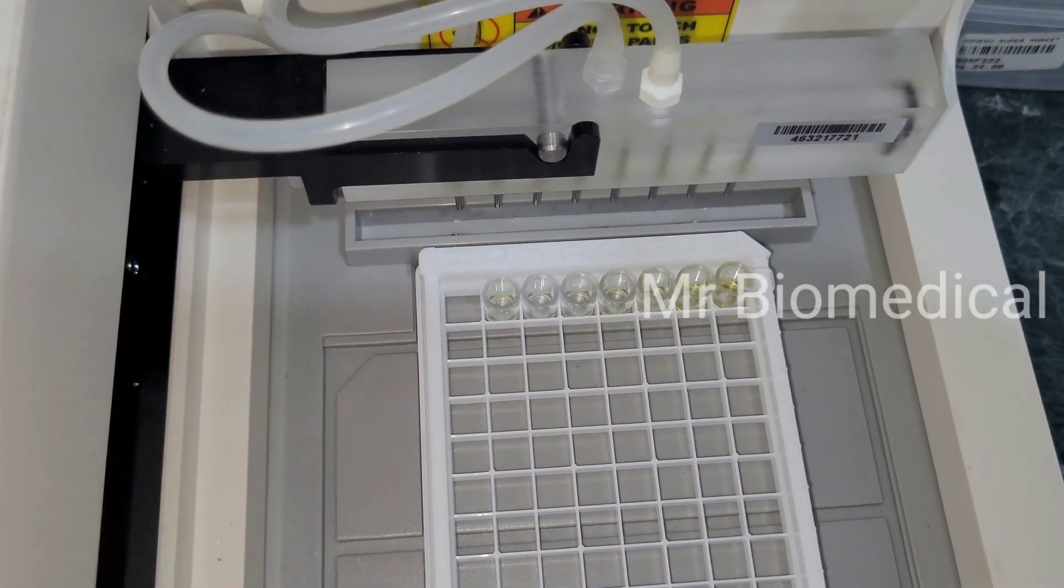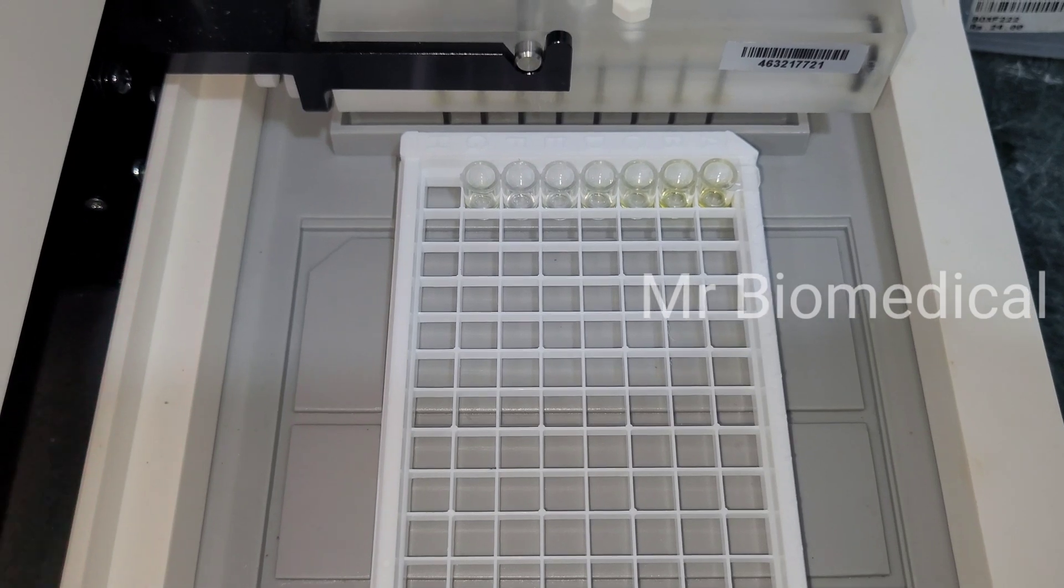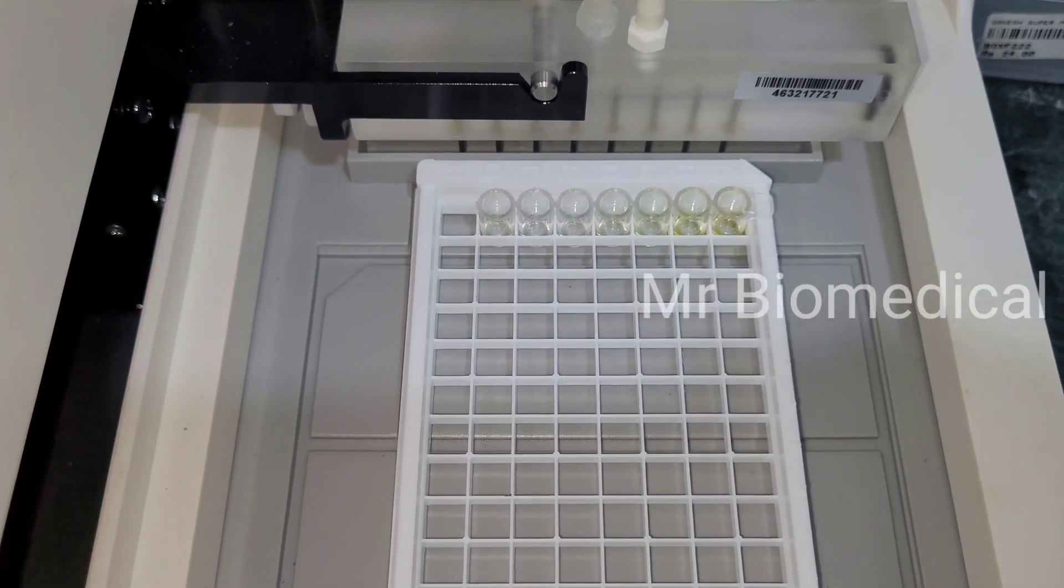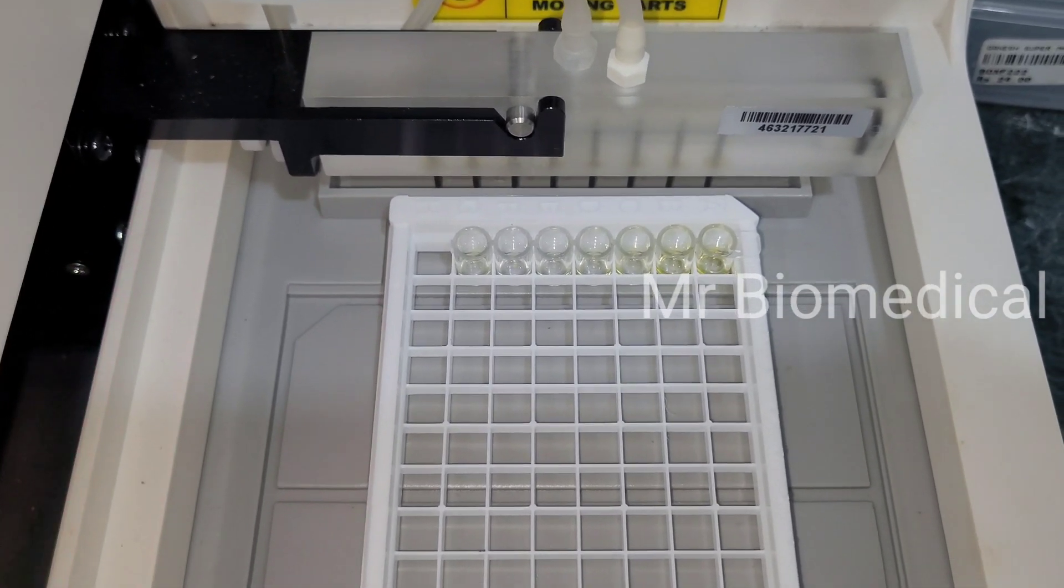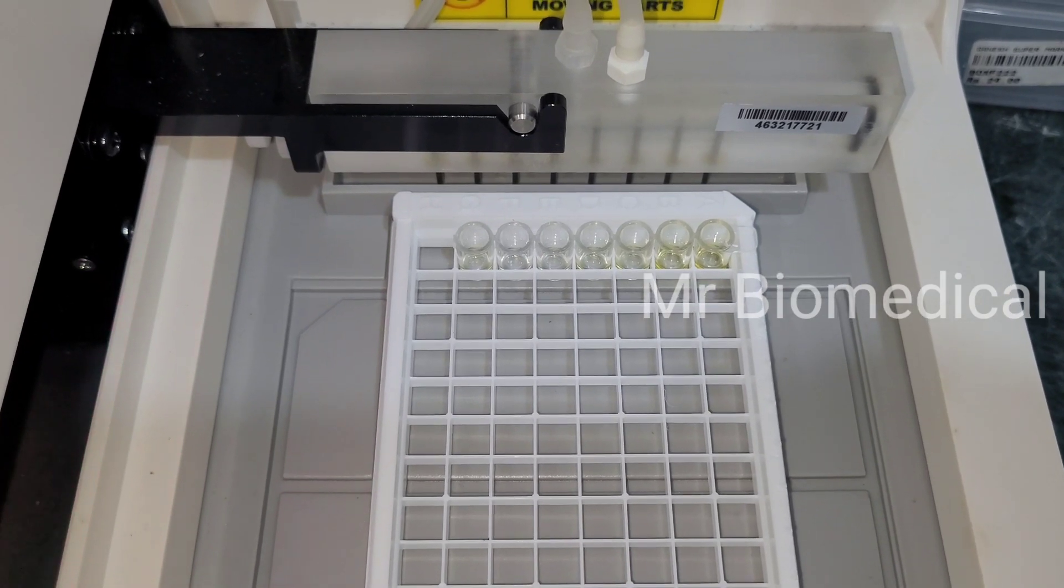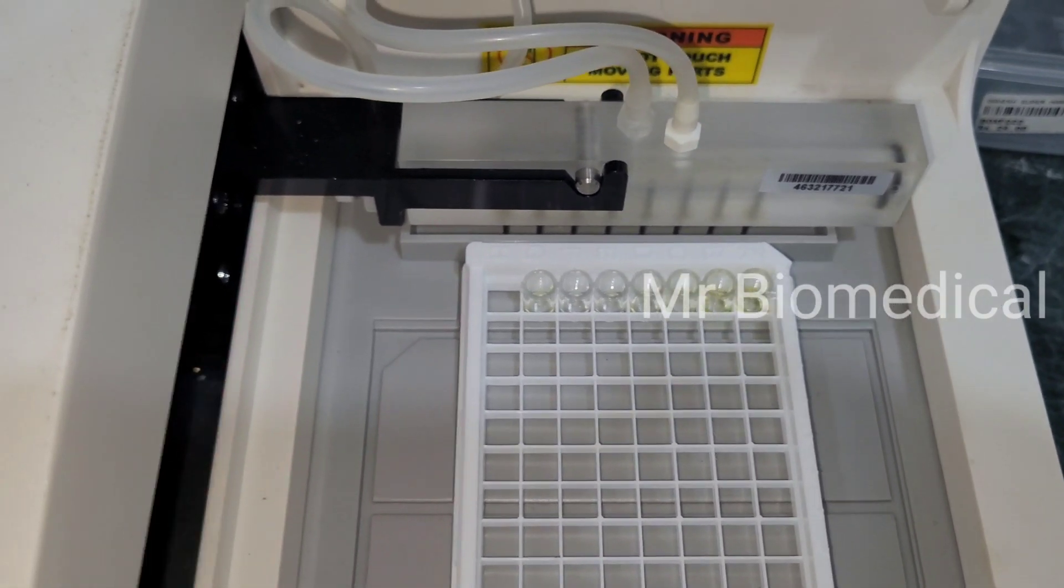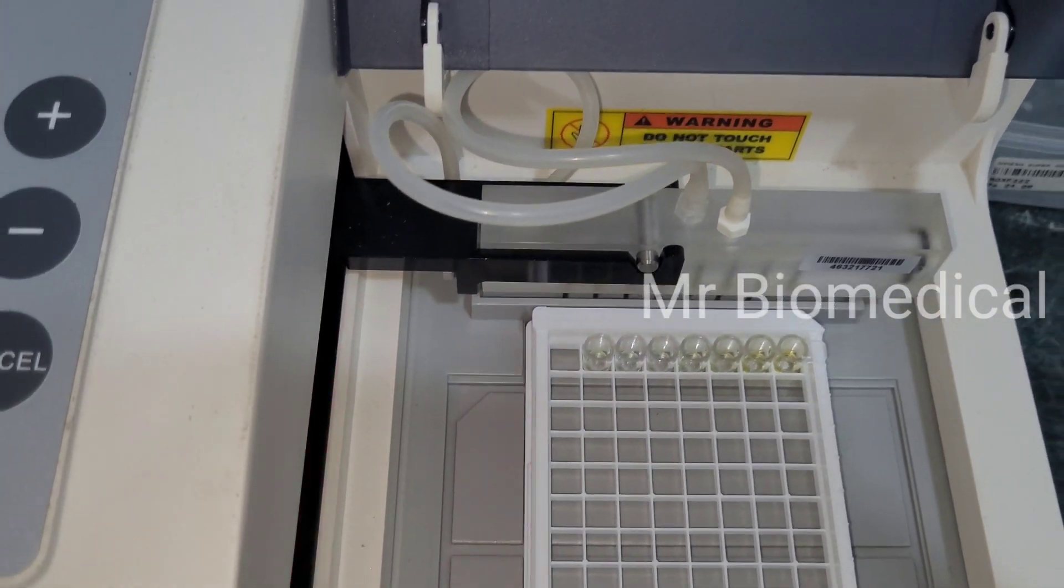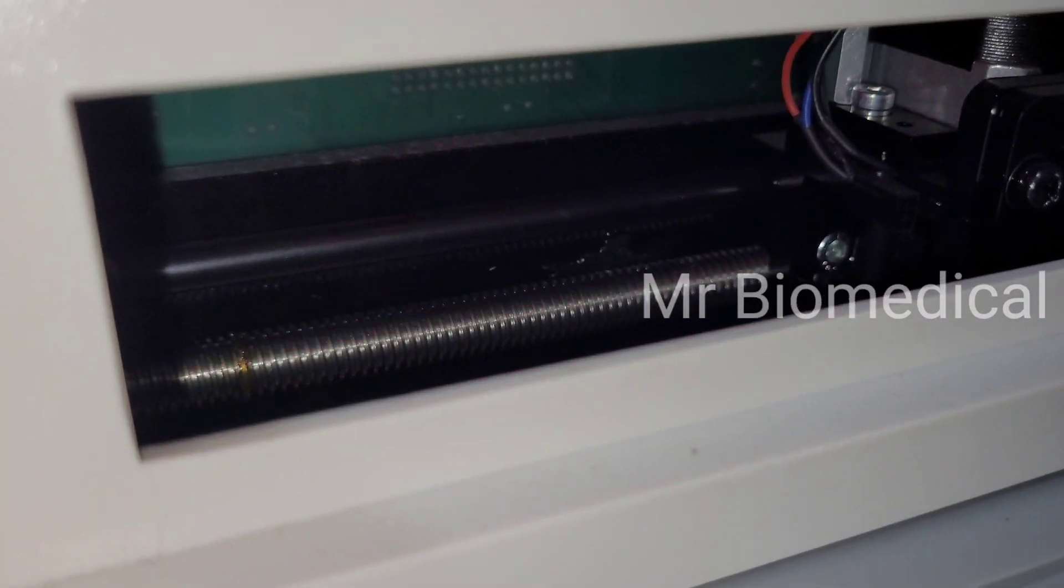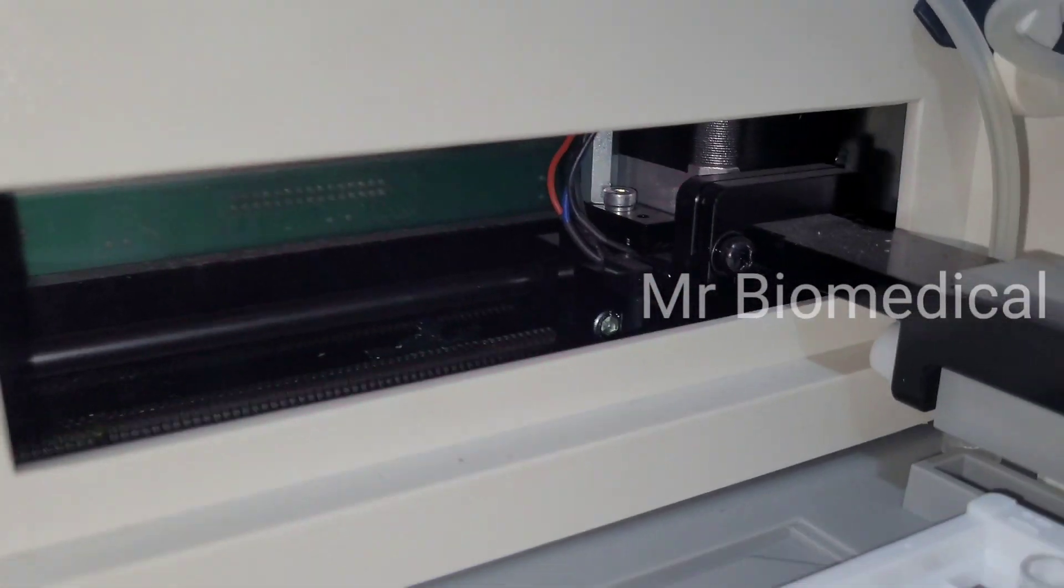The water is coming, the water will be coming in this stage itself. Now in this case water is not coming yet, but we found the problem with the DC connections and we rectified that.